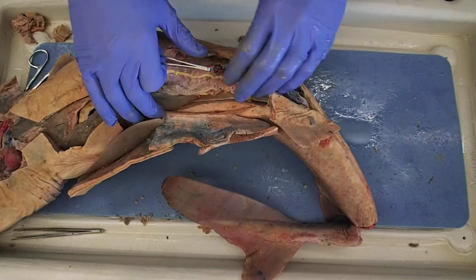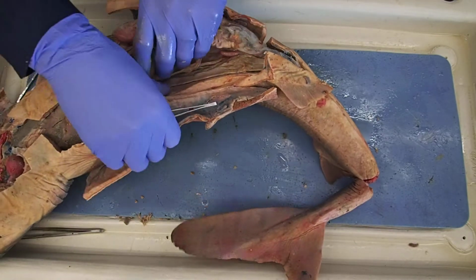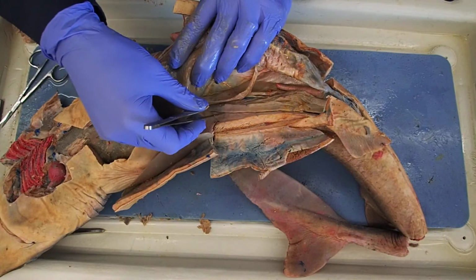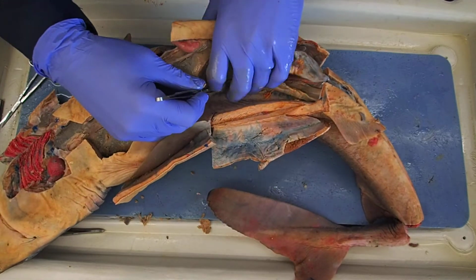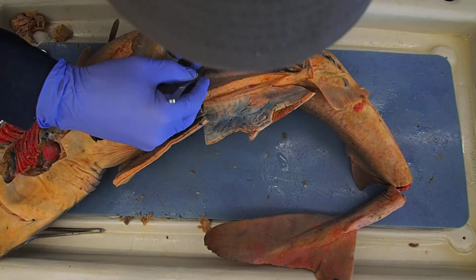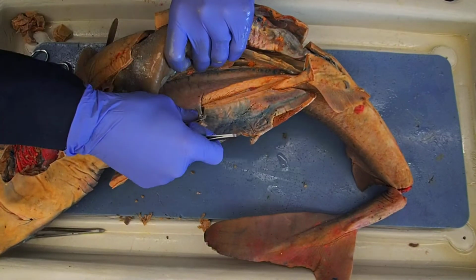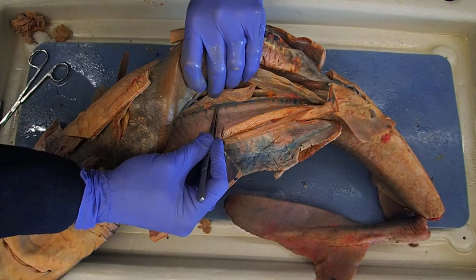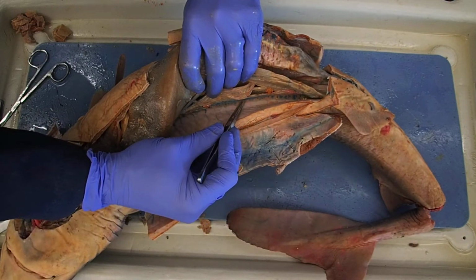And if I go to the back now, back of the body cavity, this is actually, remember, the dorsal side. Lift some things up. I can see that blue vein running down there, and I can see some discoloration.